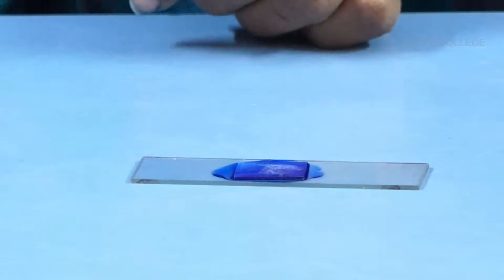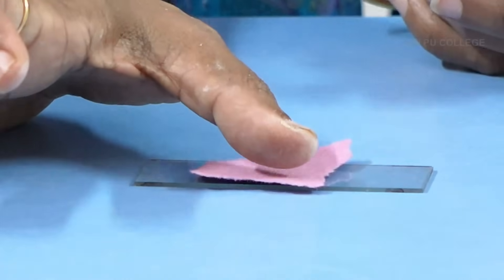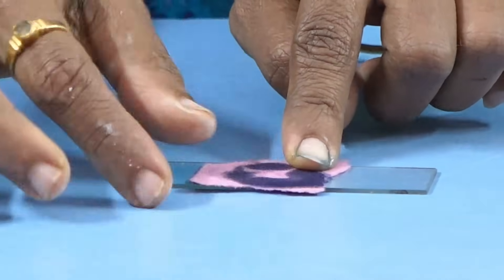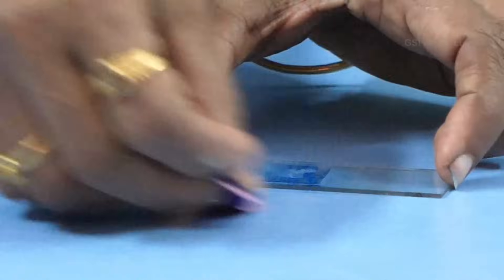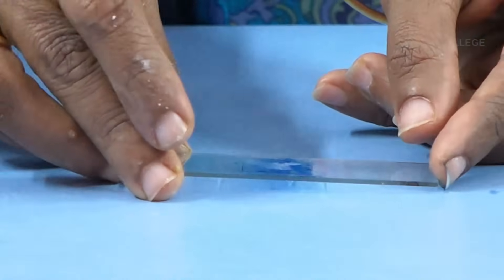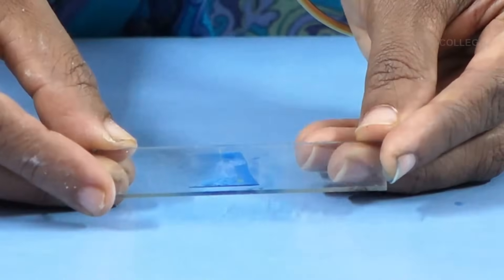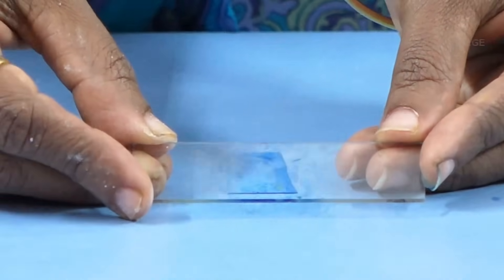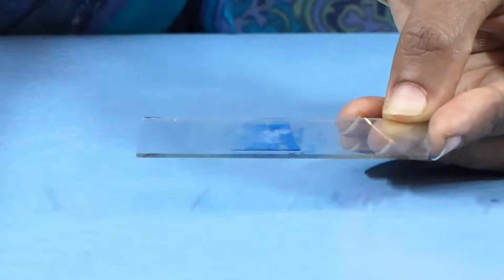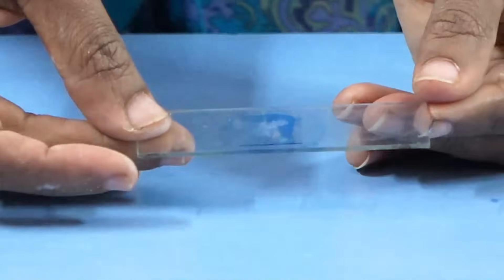Then cover this with a cover glass. Take a blotting paper and gently press it with the help of your thumb like this. This is now ready for observation. To summarize: take the style and stigma, place on a slide containing cotton blue stain, cover with a cover glass, and gently press with the thumb using blotting paper.